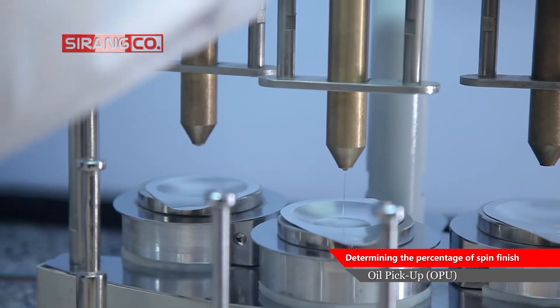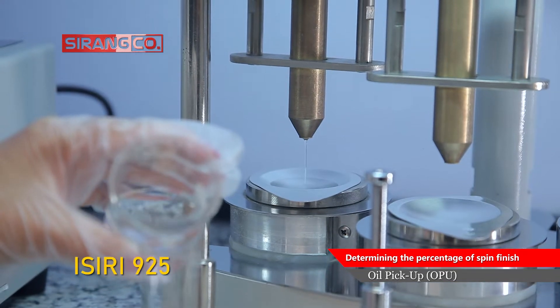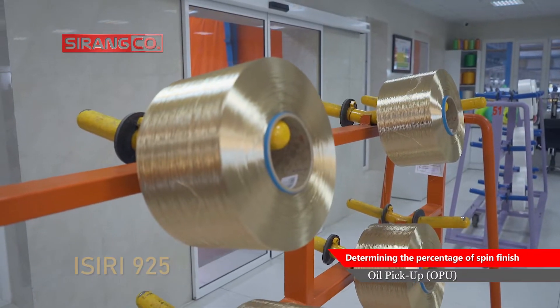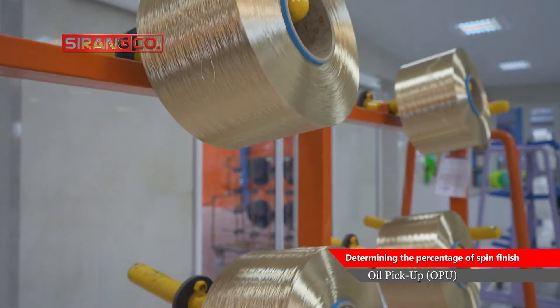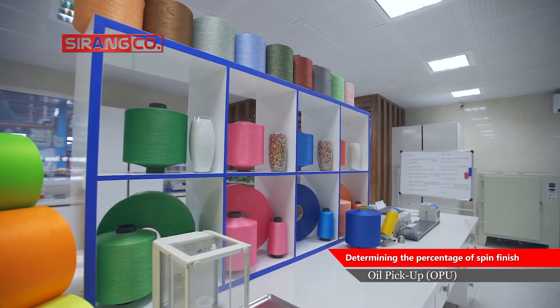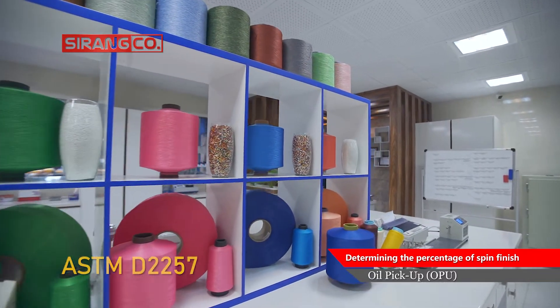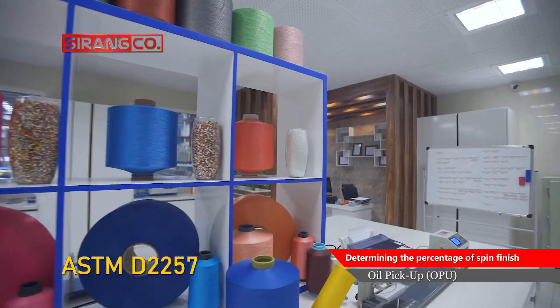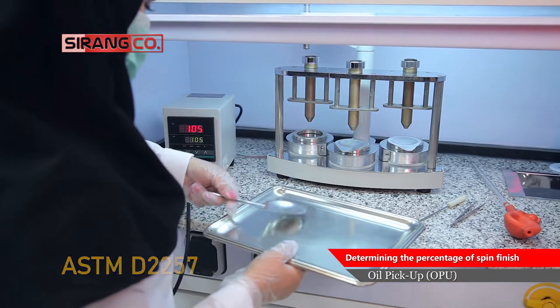Following the National Standard of Iran No. 925, to determine the percentage of FDY yarn spin finish oil, one can act according to the international standard ASTM D 2257.